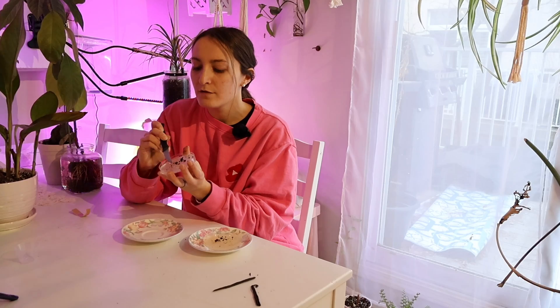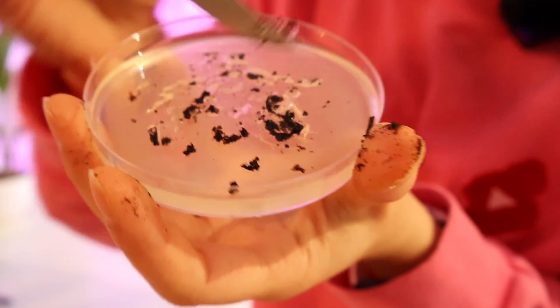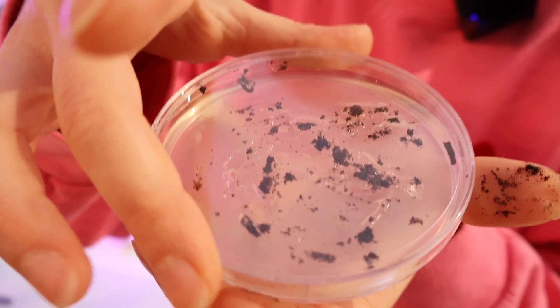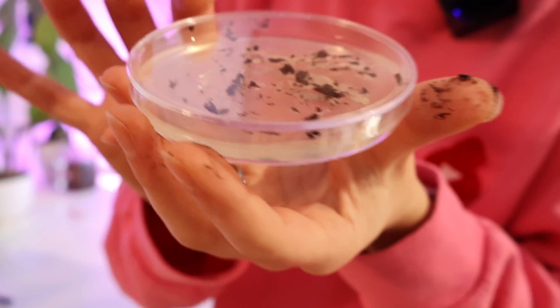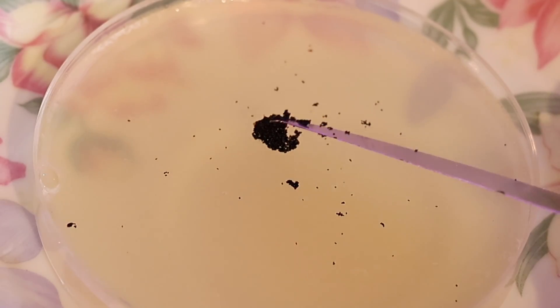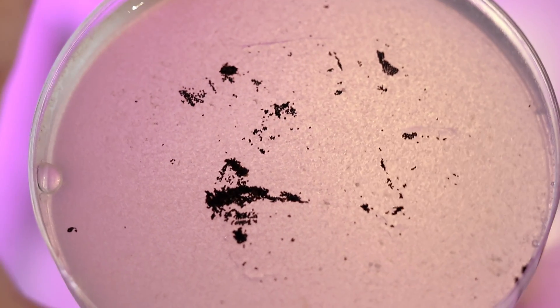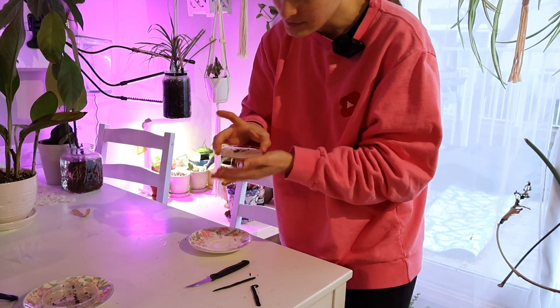As I pushed the seeds into their new homes, I learned that with vanilla, many botanists grow it with other nutrients alongside the nutrient agar — like glucose or sucrose — and that helps them grow even more successfully. Technically you don't need the mixture for vanilla to grow, but it is said to help it sprout even more. Once they do grow in this medium, you transfer them to new ones about every six to twelve months. But I didn't have any glucose, sucrose, or external nutrients, so I just followed the instructions with nutrient agar — knowing that it's usually meant to see how bacteria forms and not to sprout plant seeds, which I learned later on.